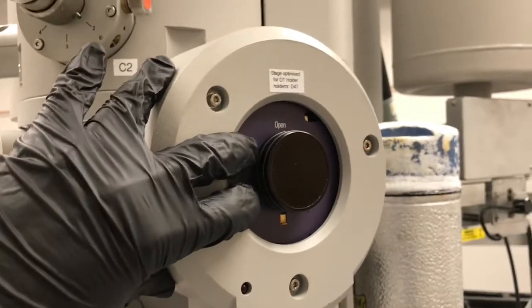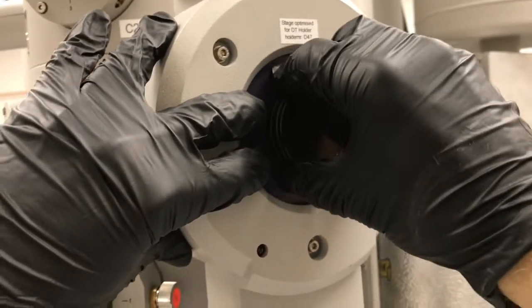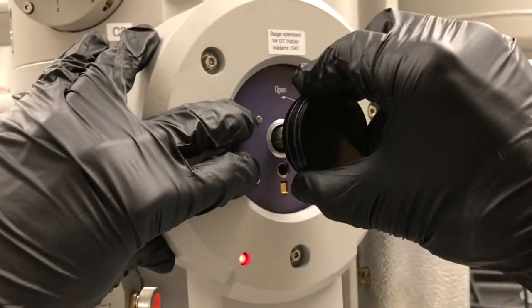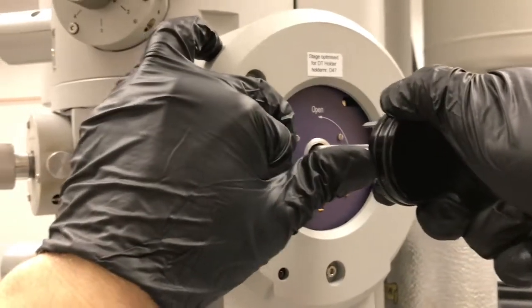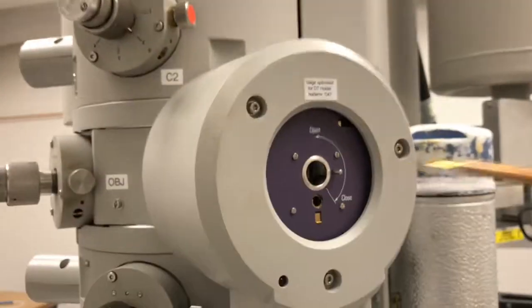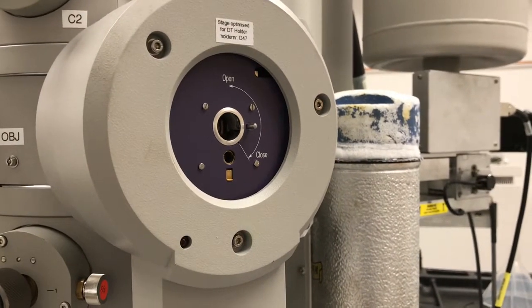Take my left hand, push against the purple plate, pull straight out, stop, turn, stop, pull straight out, use the thumb from your left hand to assist. Everything's fine.